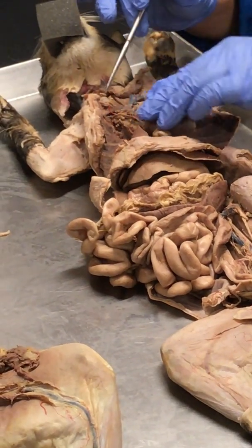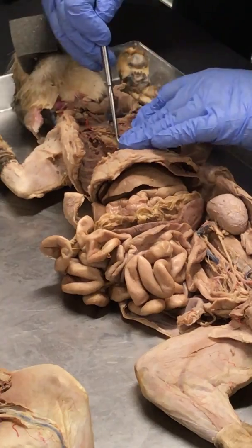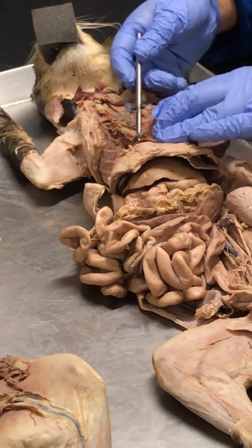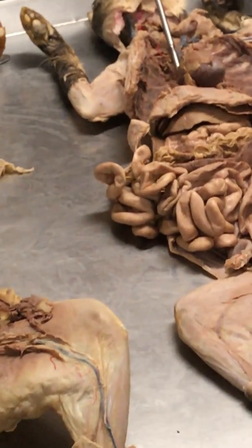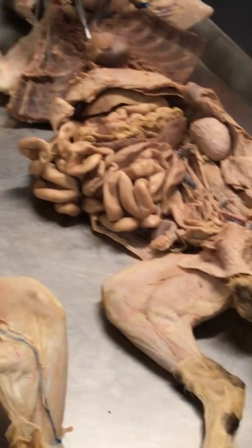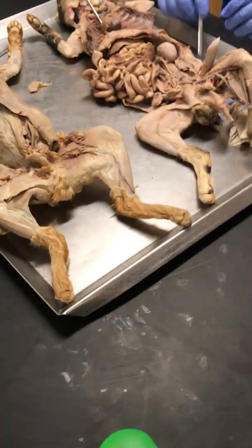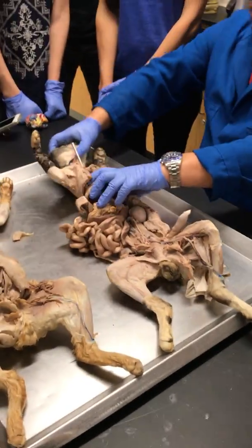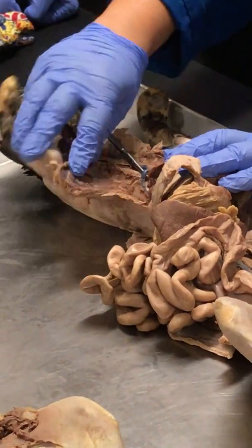That's next time. On this side, I cut it on the tabs, but you can kind of see an interesting vessel right there. You see that? So you guys on that side, that's the esophagus, right? It's the esophagus right there. And then you guys on this side, see that?